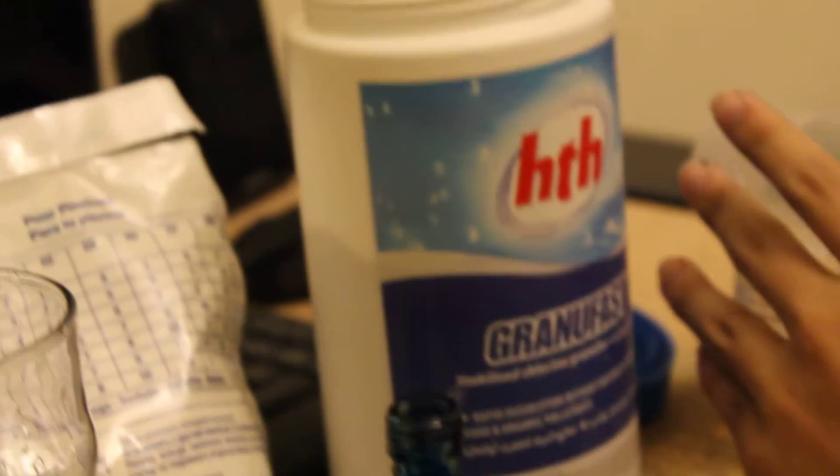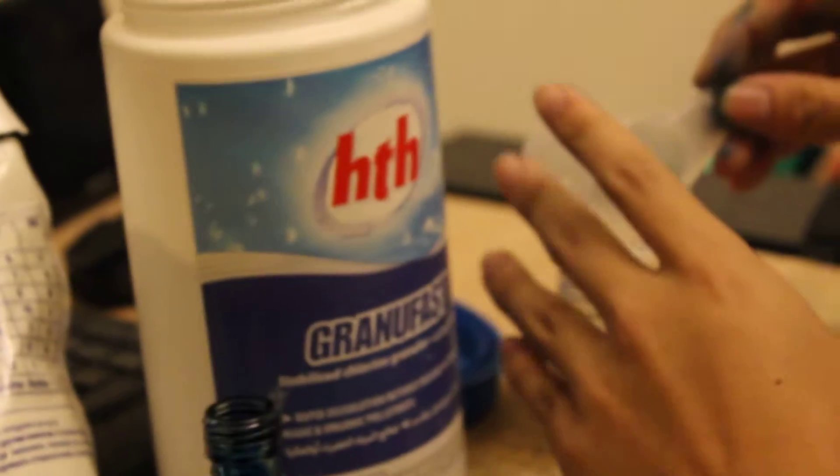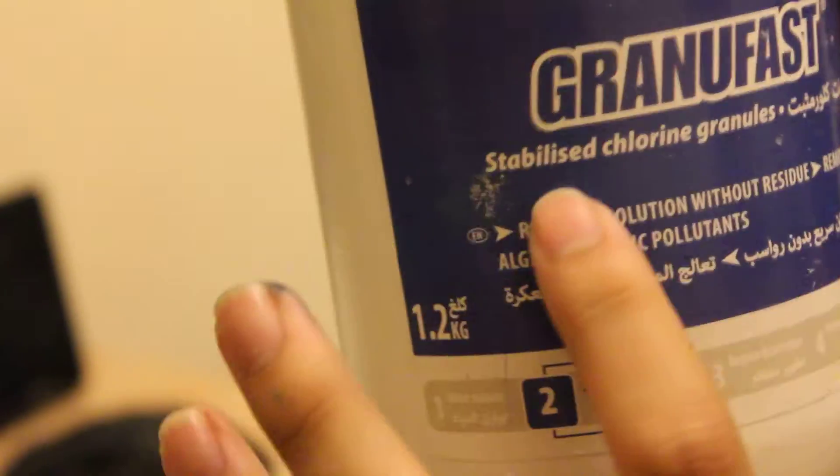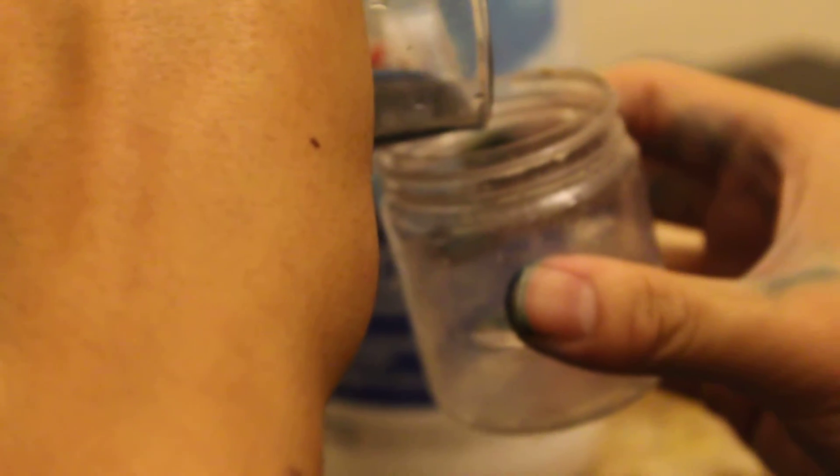Now this alone is not an indicator for chlorine, as I will demonstrate right now. I'm just adding a little bit of any chlorine-containing compound. In this case, we have sodium dichloro isocyanurate. Now just add a little bit of this and you can see that nothing will happen. It stays blue. Basically, it doesn't work.